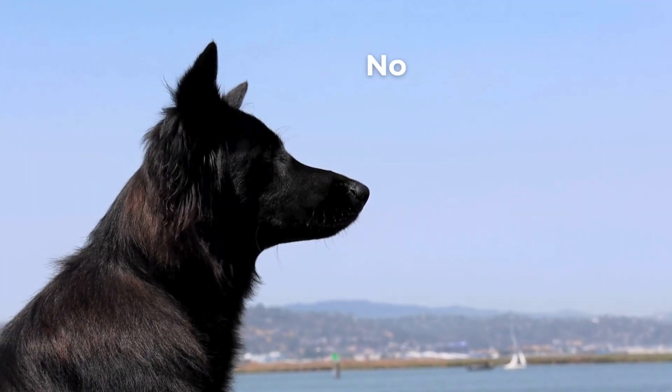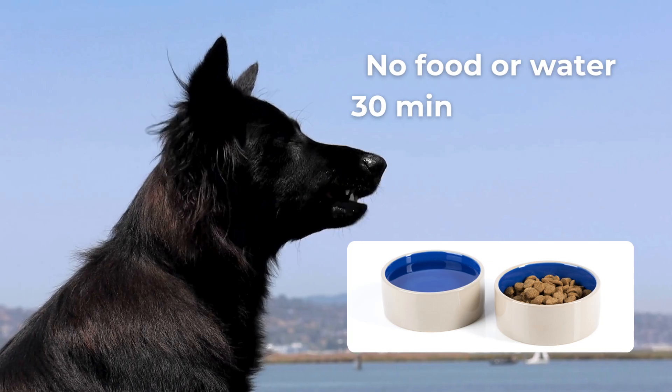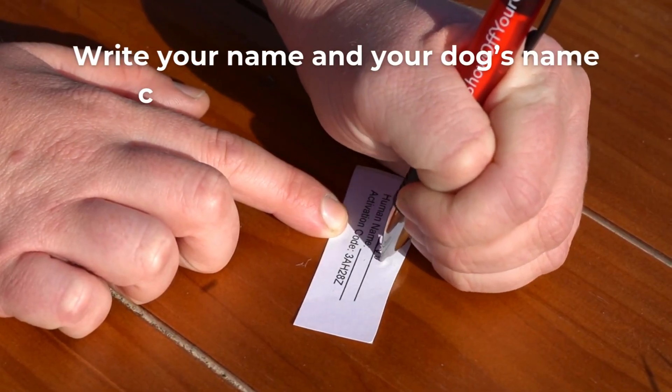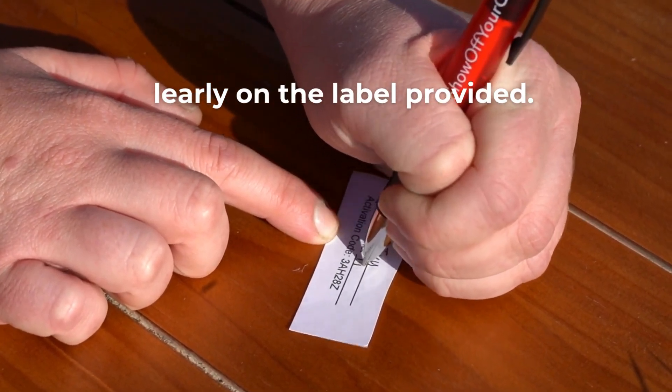Before getting started, make sure your dog has not had anything to eat or drink for 30 minutes. Write your name and your dog's name clearly on the label provided.